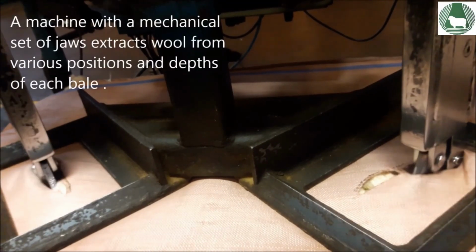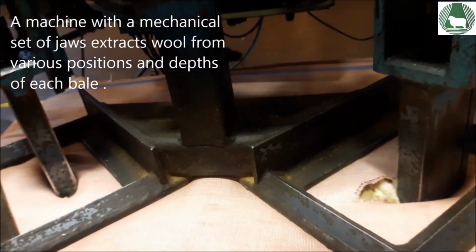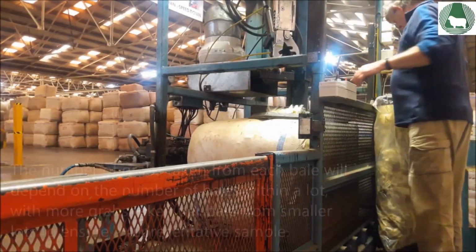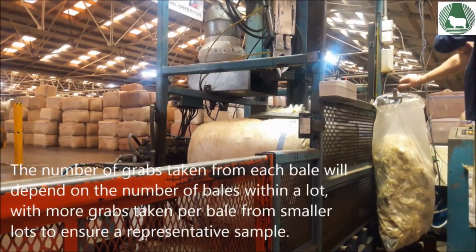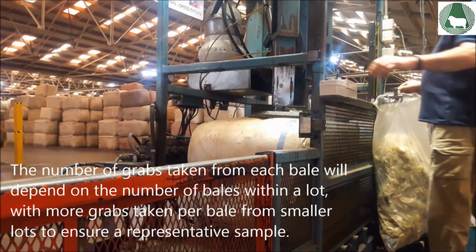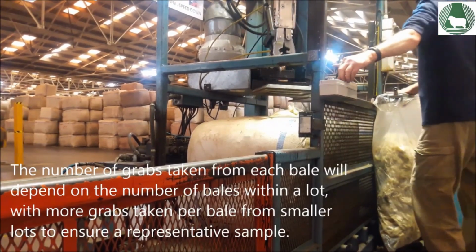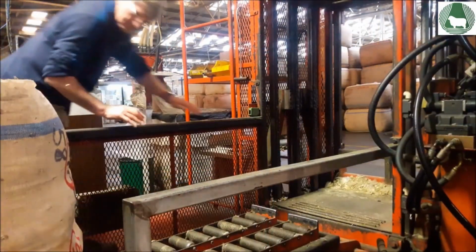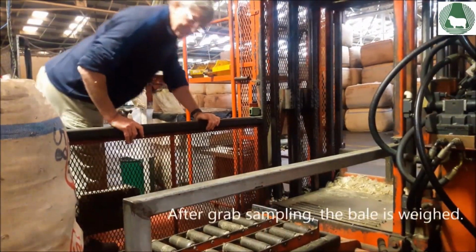Grab sampling requires a machine with a mechanical set of jaws to extract wool from various positions and depths of each bale, so that each portion of wool has an equal chance of being selected. The number of grabs taken from each bale will depend on the number of bales within a lot, with more grabs taken per bale from smaller lots to ensure a representative sample.